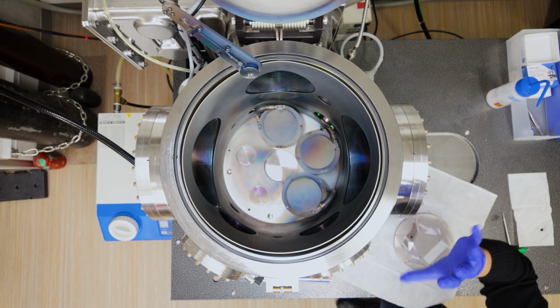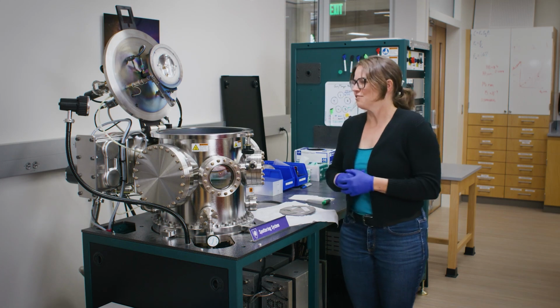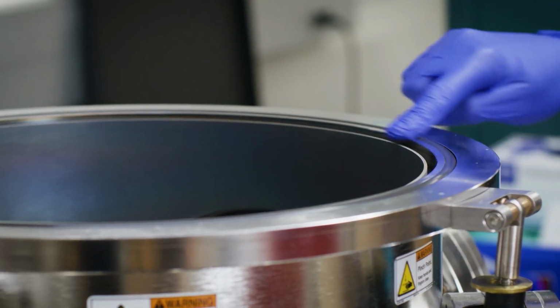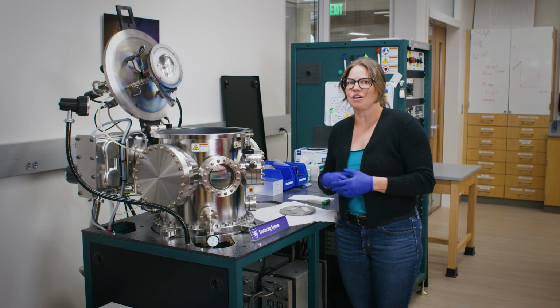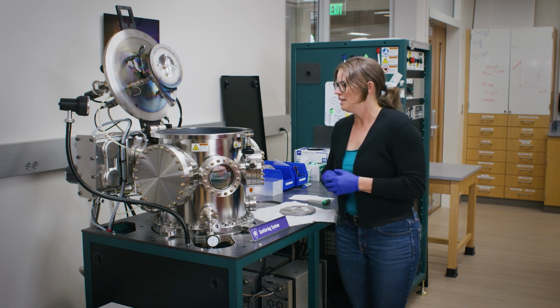So this chamber forms a vacuum system that we take all of the air out of this tool. You notice there's this kind of black circle here. That's really a gasket that helps seal the system up so when we turn on the vacuum pumps, all the air can get taken out.